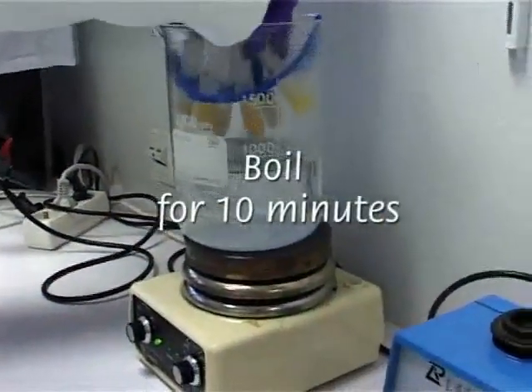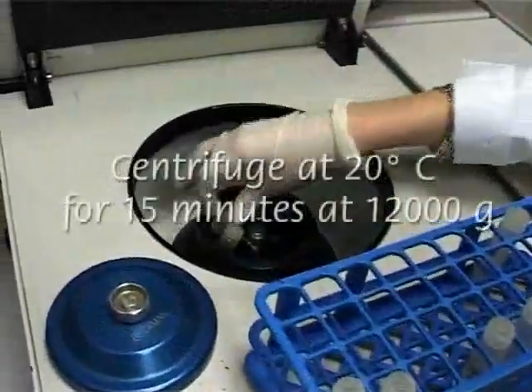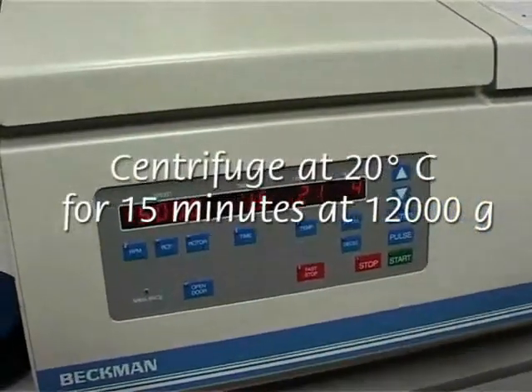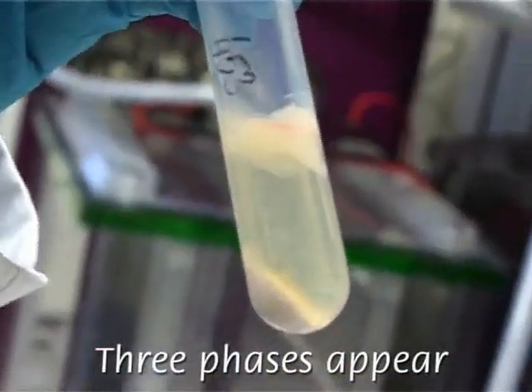Samples are boiled in order to dissolve cell walls and hydrophobic proteins. The presence of SDS prevents the formation of oligomers that abort precipitation of proteins. A centrifugation step separates 3 phases. Proteins are suspended in the transparent solution that is collected in a new tube kept on ice.